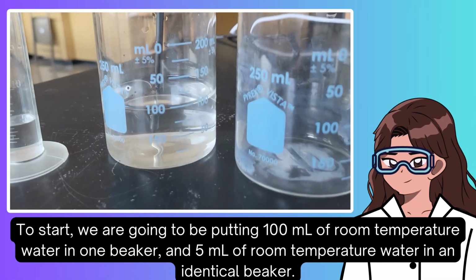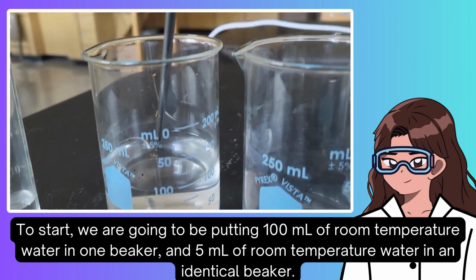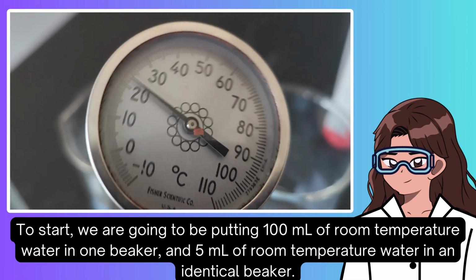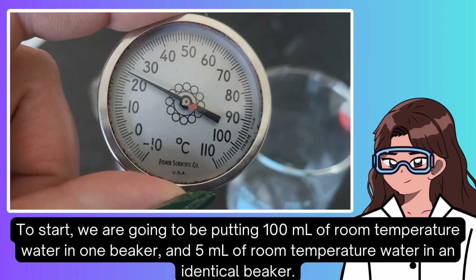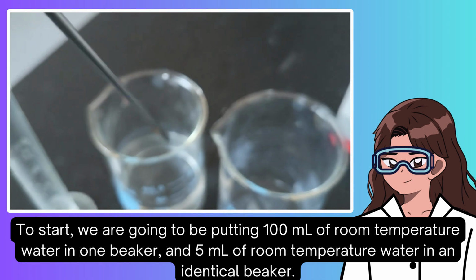To start, we are going to be putting 100 milliliters of room temperature water in one beaker and 5 milliliters of room temperature water in an identical beaker.